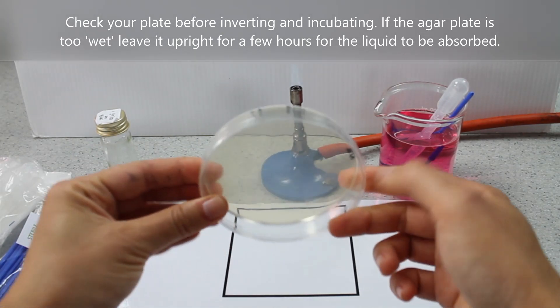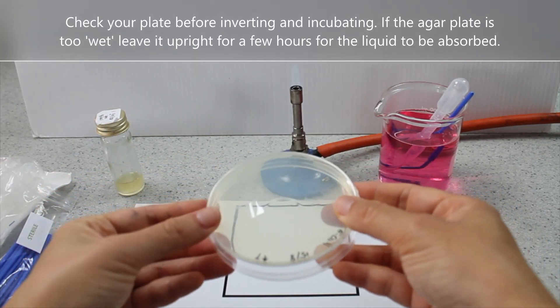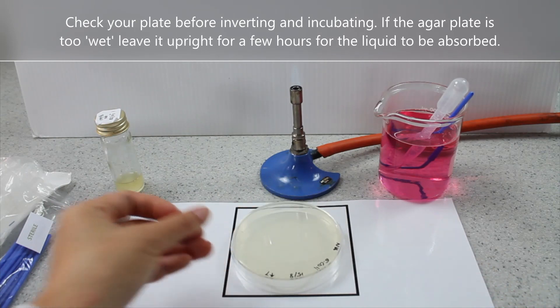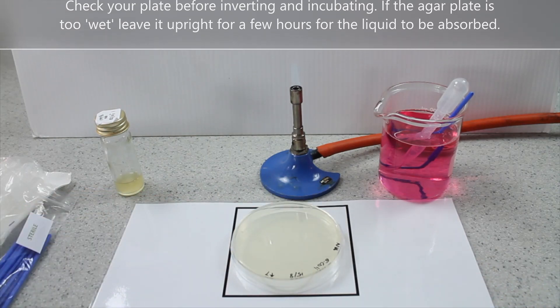Check your plate before inverting and incubating. If the agar plate is too wet, leave it upright for a few hours for the liquid to be absorbed.